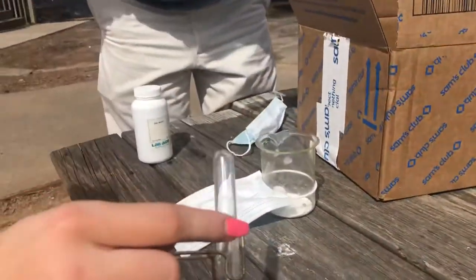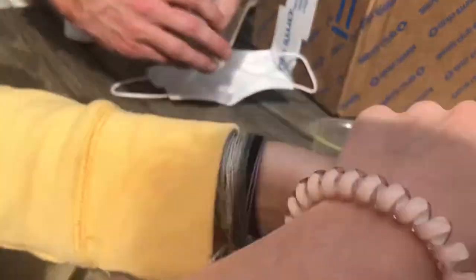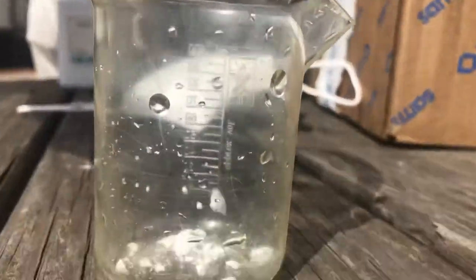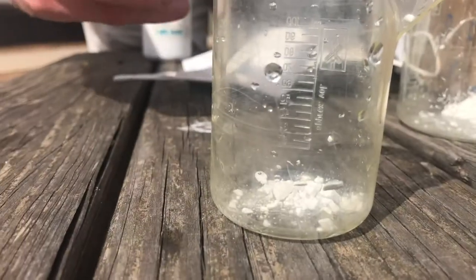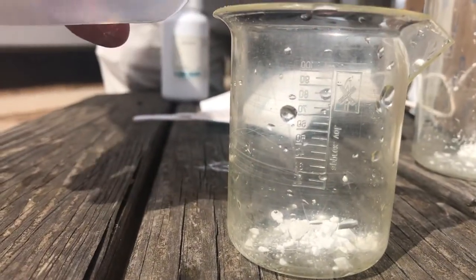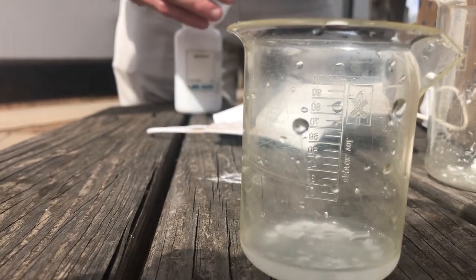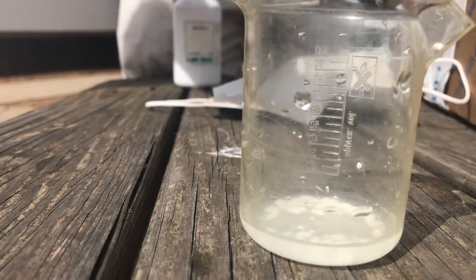We're going to start with a little bit of chalk. The chalk here represents rocks and other things that may be affected by acid rain — granite, marble. To simulate that, we're going to use a very dilute sulfuric acid, and we're just going to watch for a little bit. The first thing you'll see almost immediately is some of that chalk starts to dissolve.